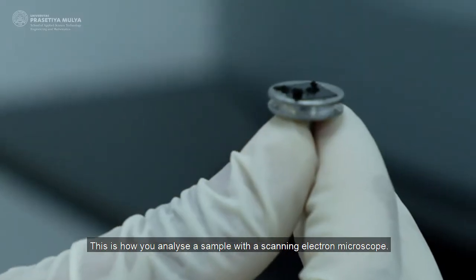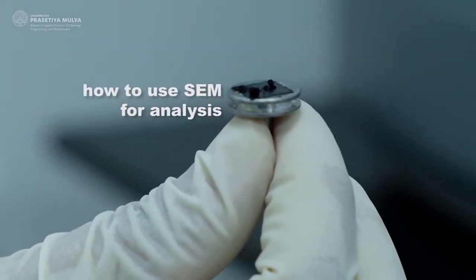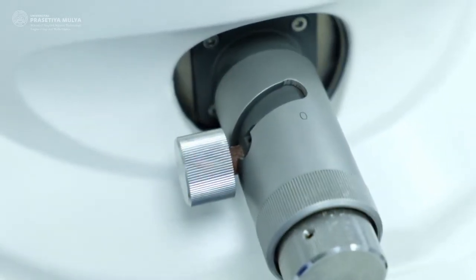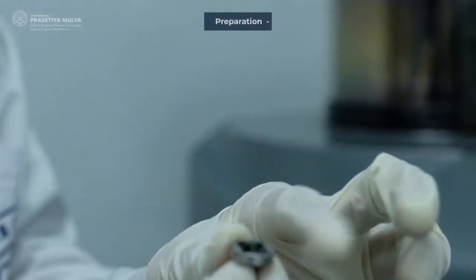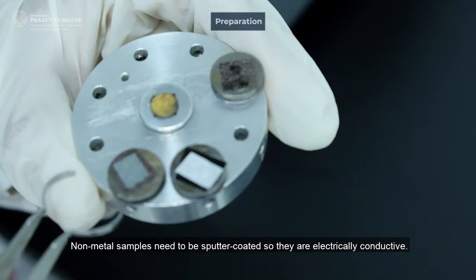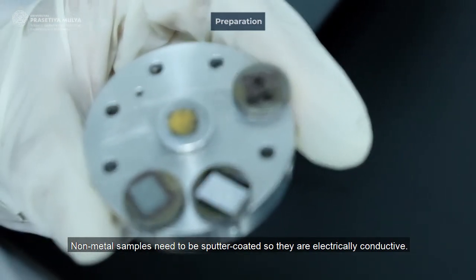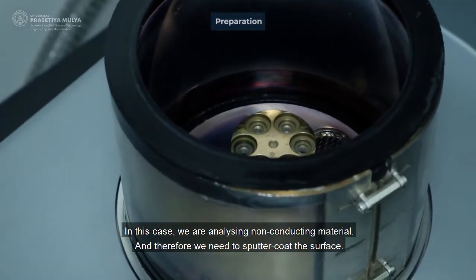This is how you analyze a sample with a scanning electron microscope. Samples need to be small enough to fit the specimen room. Non-metal samples need to be sputter-coated so they are electrically conductive. In this case, we are analyzing non-conducting material, and therefore we need to sputter-coat the surface.